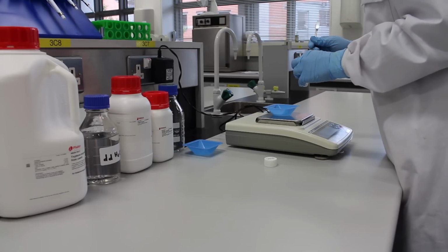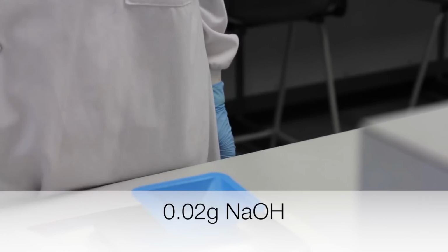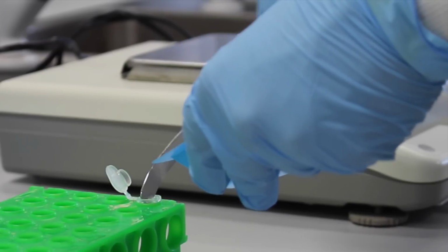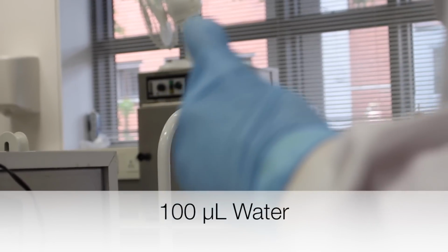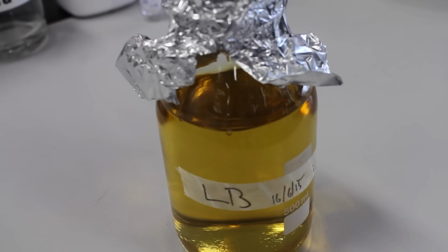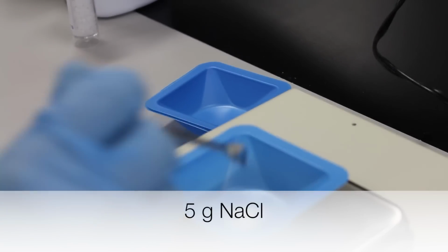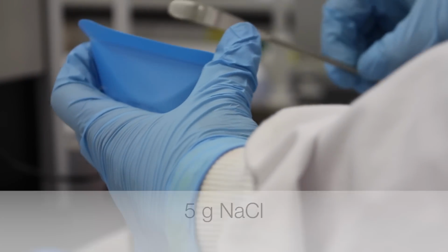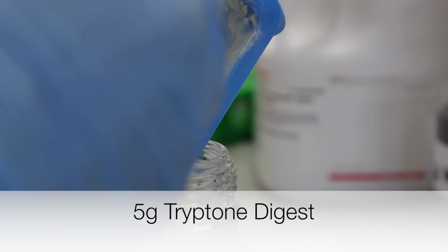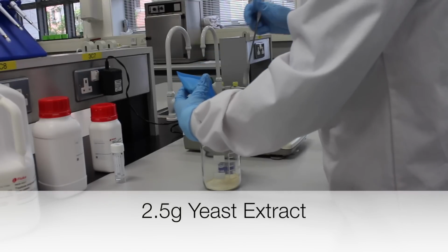First, a 5 molar sodium hydroxide solution is prepared in the following way. 0.02 grams of sodium hydroxide is weighed out and transferred to an Eppendorf tube. The salt is dissolved in 100 microliters of water. To make 500 milliliters of LB, the following are added into an empty glass bottle. 5 grams sodium chloride, 5 grams tryptone, and 2.5 grams yeast extract.